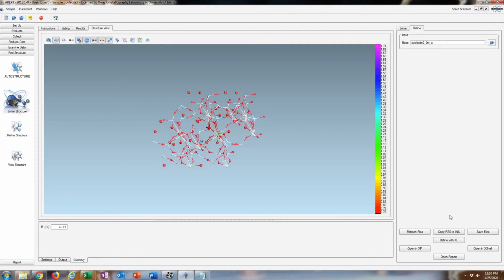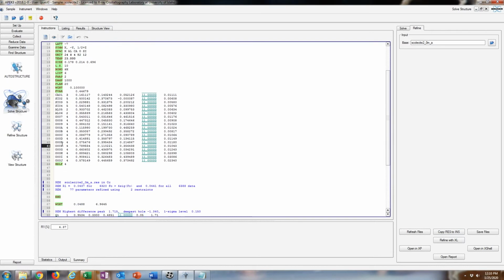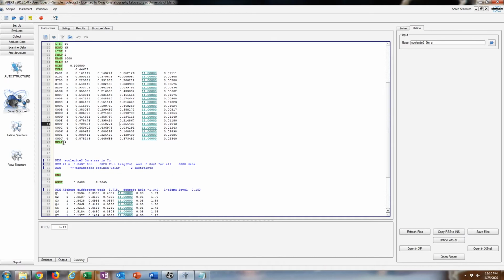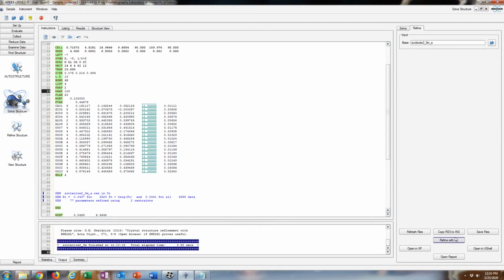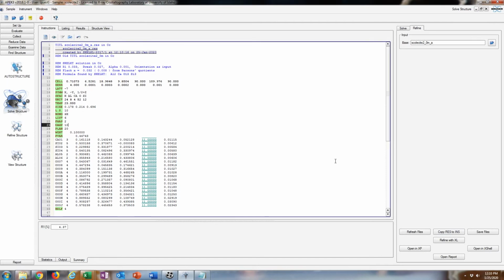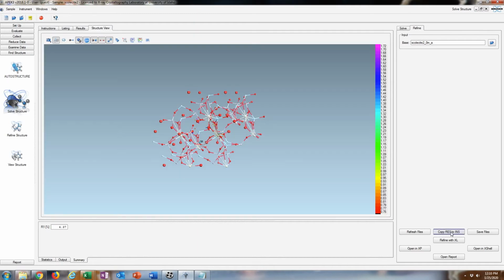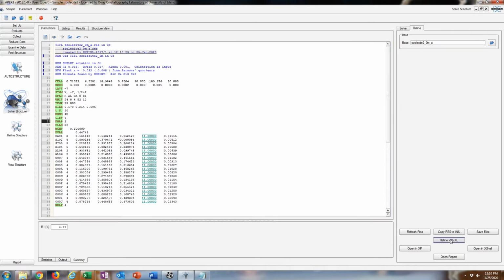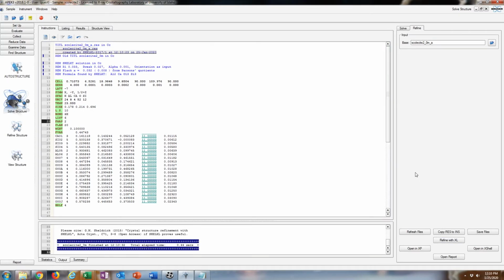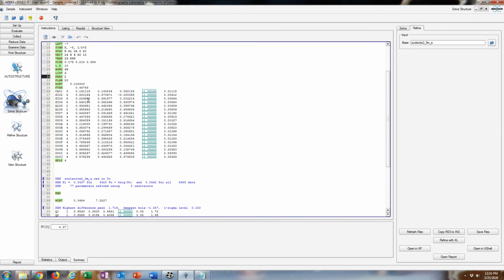Alright, that looks good. I dampened the structure. DAMP 1000 is the command, just in case it blows up. That will control it a little bit. And this actually worked immediately because it's in the correct convention, or it was the correct lattice after all. So those are the fractional coordinates you want to use. And I will take away the damp command. It's just a way of controlling how aggressive the refinement goes.